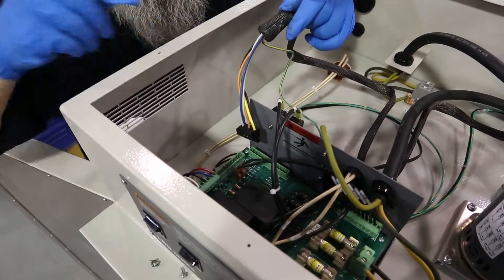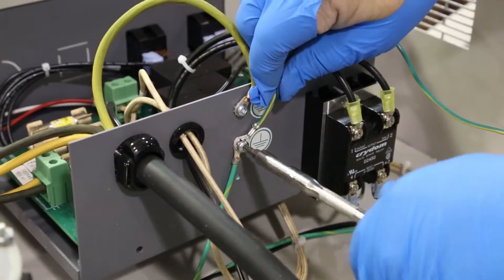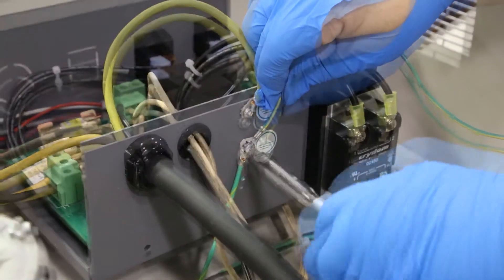Disconnect the motor lead from the controller. Disconnect the ground wire with a T20 driver.